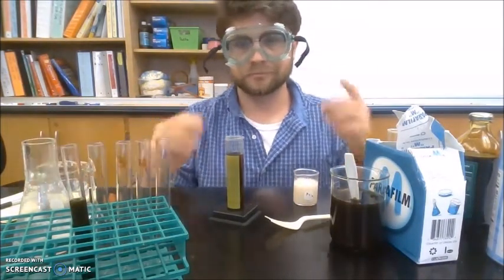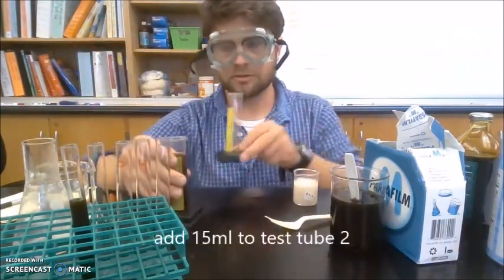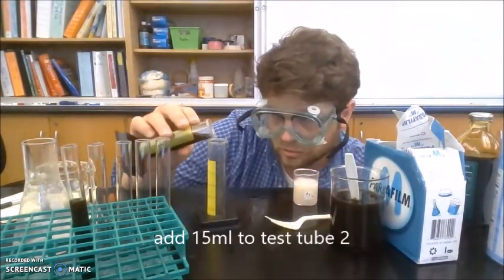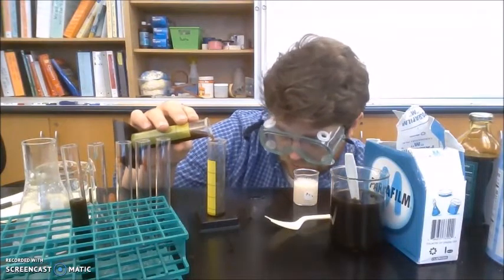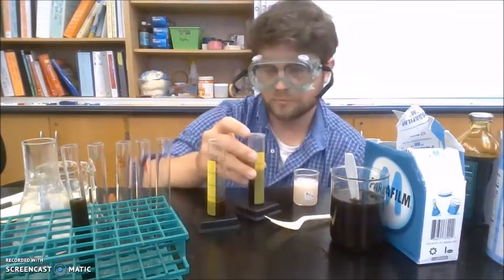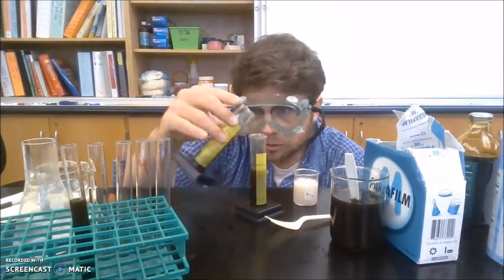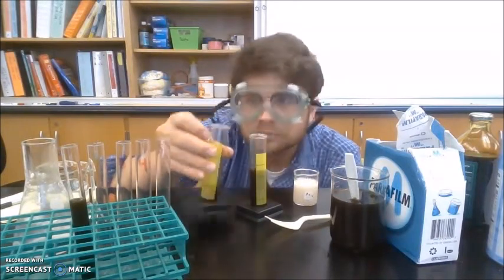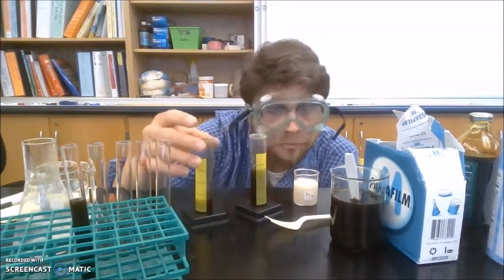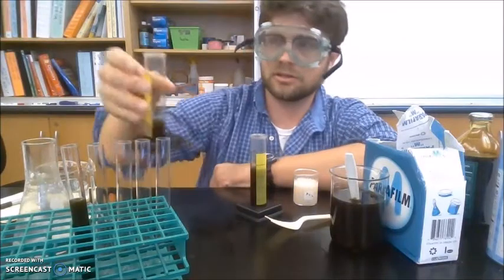Okay. So now here, I want to add 15 milliliters to my test tube. So I'm going to measure it in my other graduated cylinder. Need to dump a little more. Okay, so I'm measuring at eye level. I have 15 milliliters.